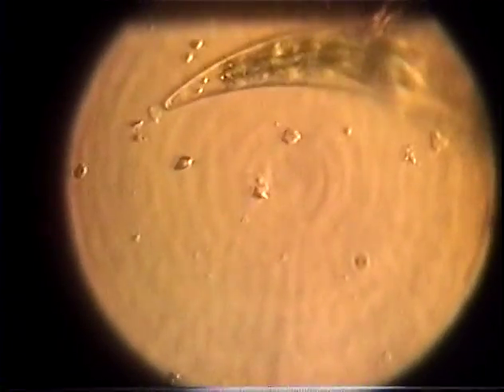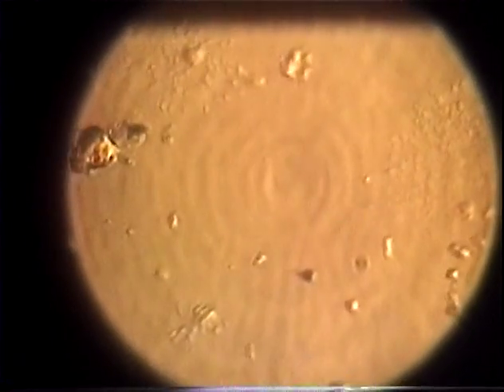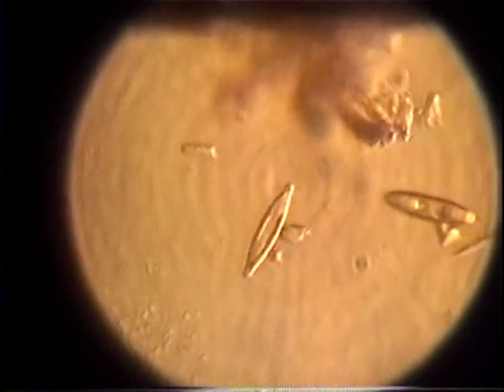Yeah, choose a better one. You won't be able to get anything more out of this one. What is that? All right, we'll pop down to this power again, okay? We've got a couple other diatoms here. Let's zoom in. I want these drawn.